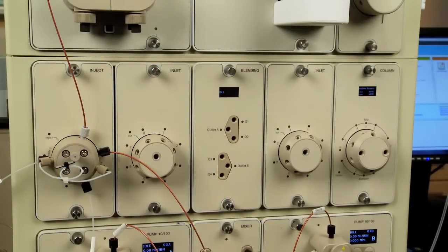Discover systems now require plumbing of the buffer inlet valve, sample pump, buffer blending valve, and pH valve.